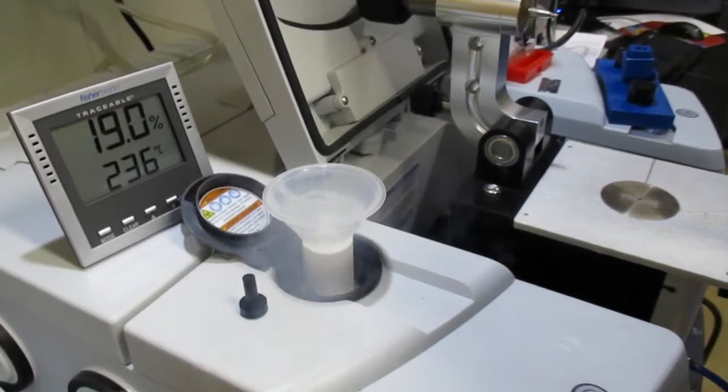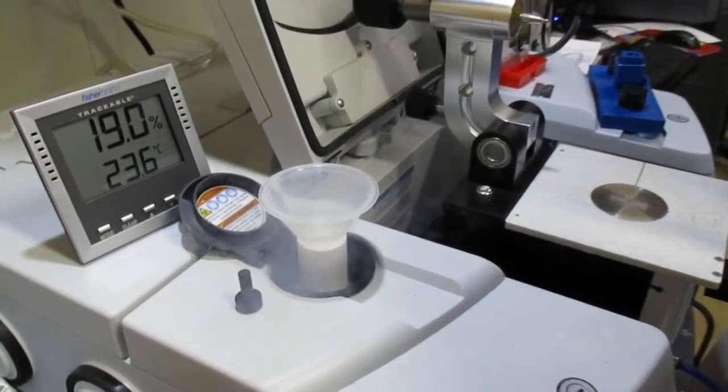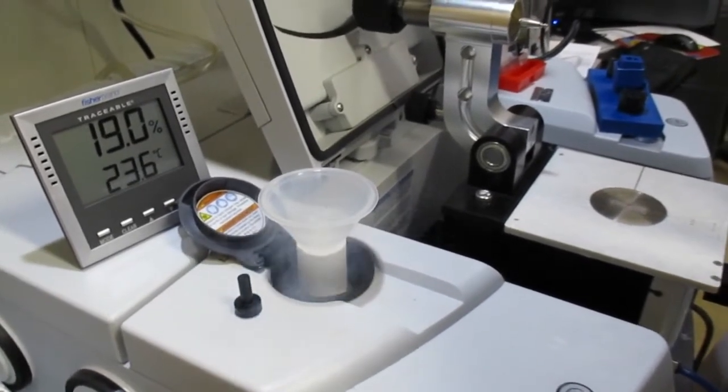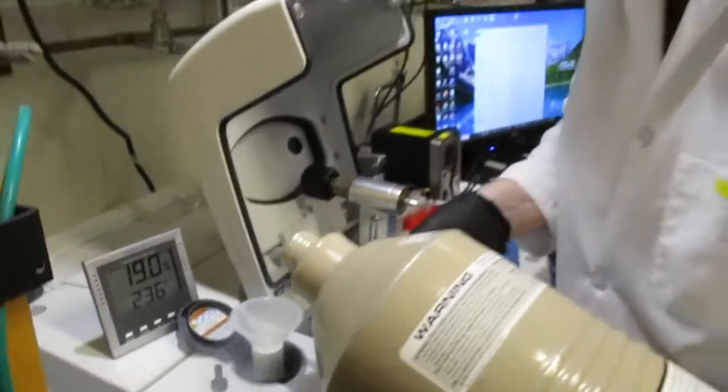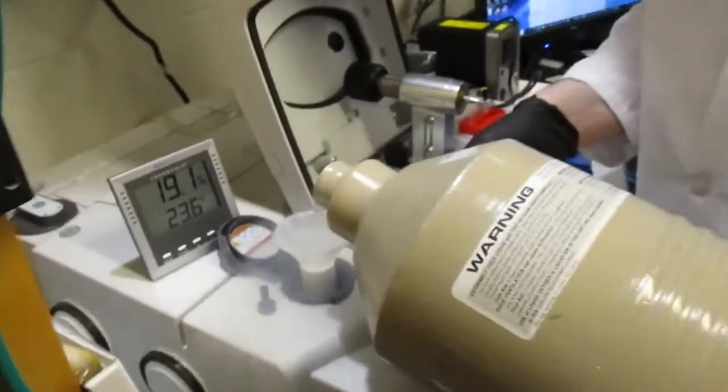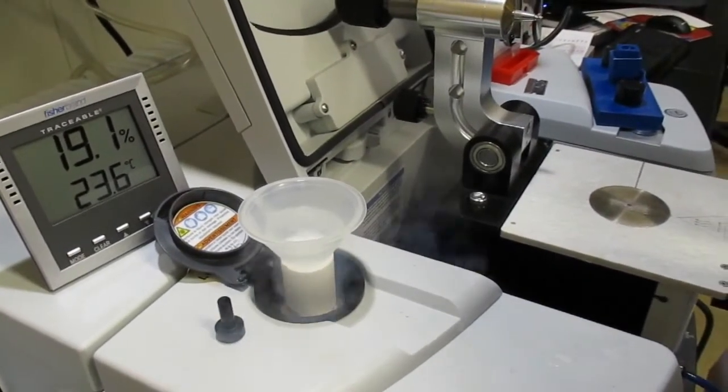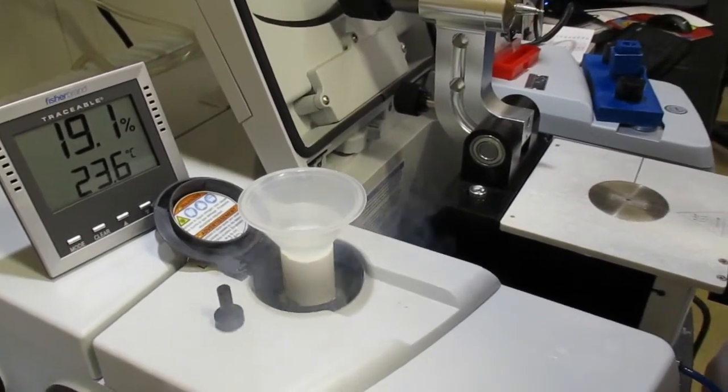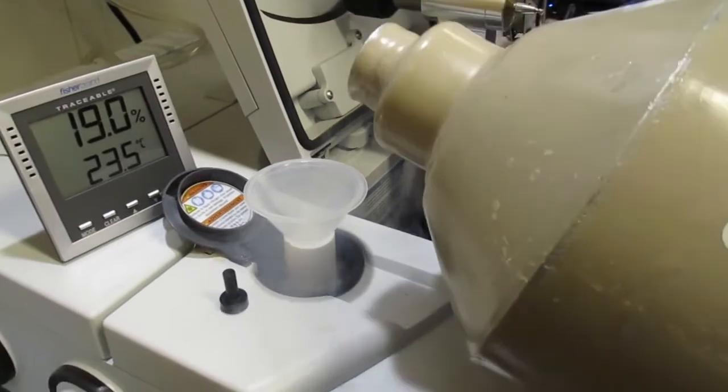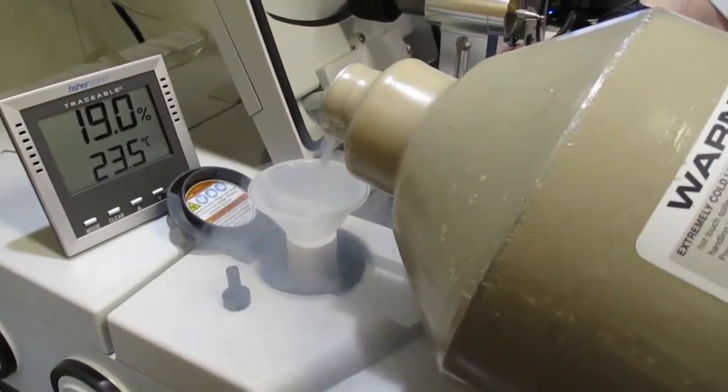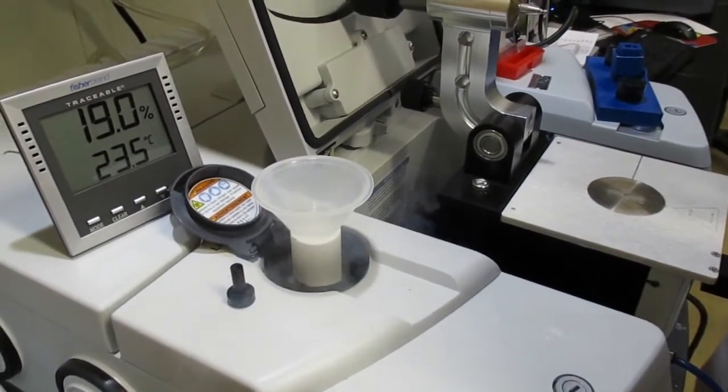And the simplest way is you keep doing it until you see it coming off the top, just like we did when filling the liquid nitrogen dewar. And this process usually takes several minutes.